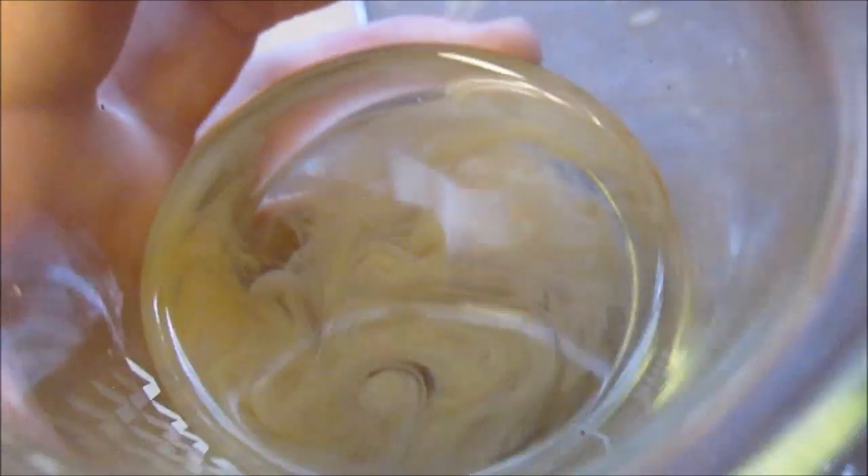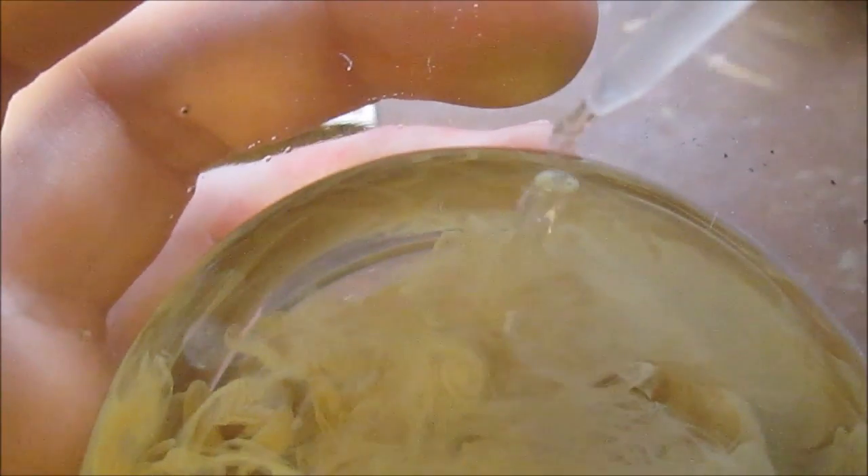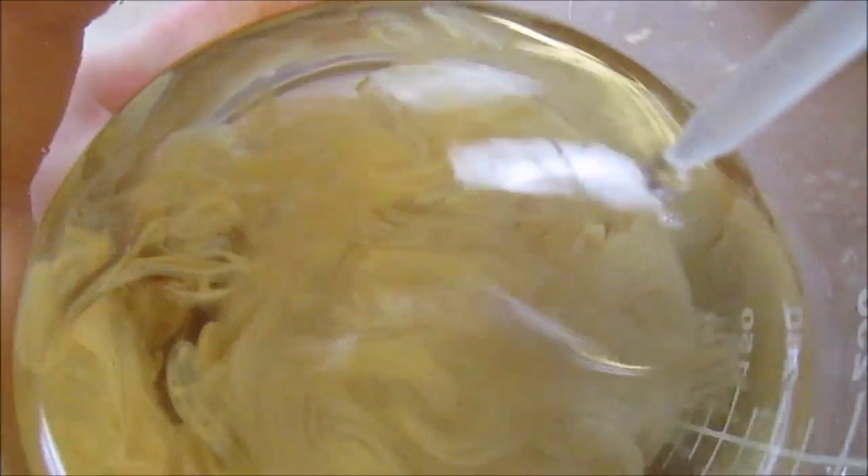I can't say it's the prettiest. It does look sort of like paint, but to see two clear solutions precipitate out at such a dark color — it almost looks like something you would see in a movie, really.